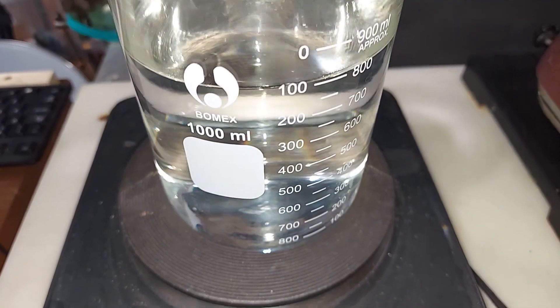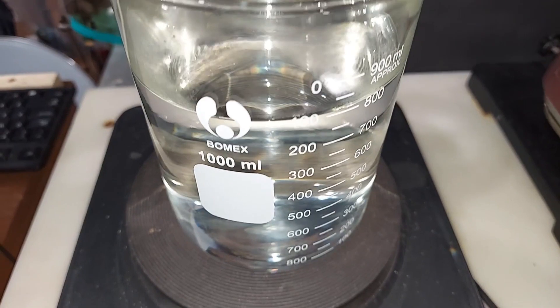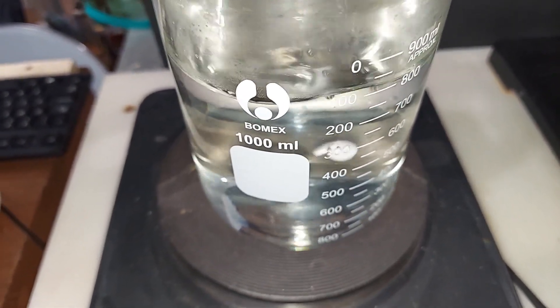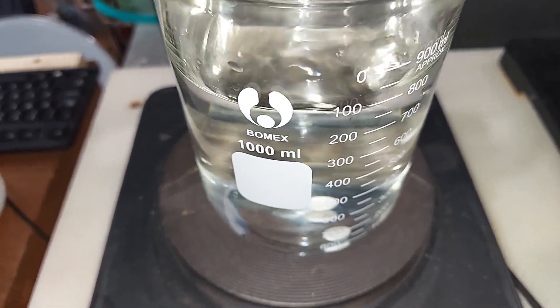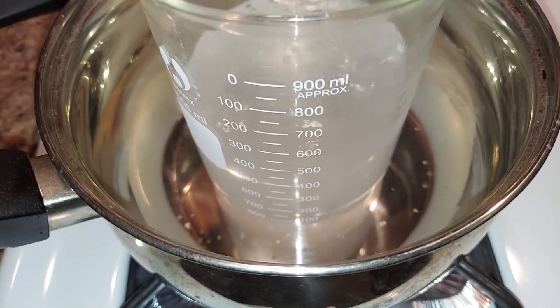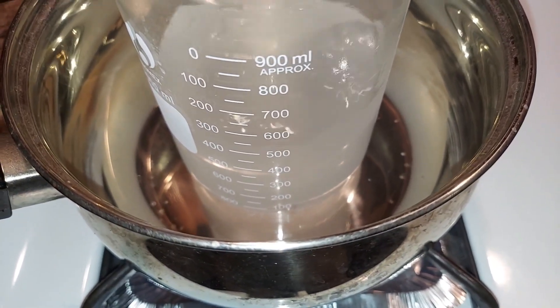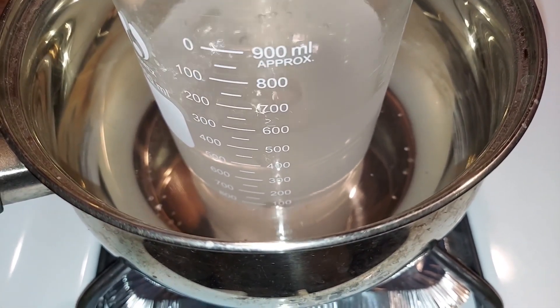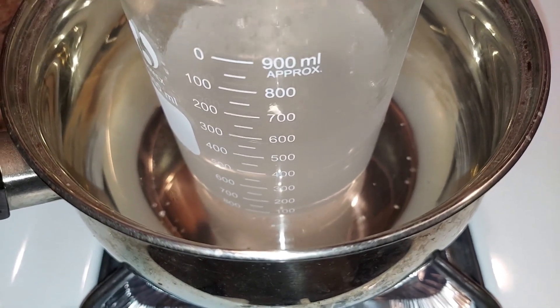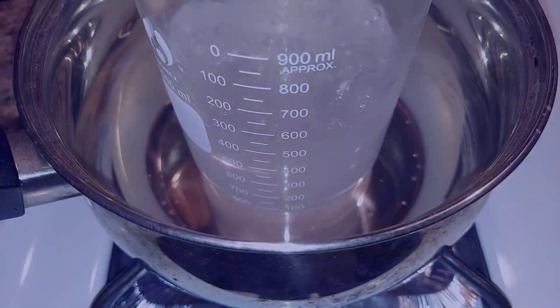Due to the fact that we're using distilled water and the glass has very few imperfections, there are no bubbles, but it is at boiling temperature, so I'm going to start adding aspirin. Once I added the aspirin, I couldn't get this to fully boil in the lab so I brought it home and it's on the stove here boiling away. It should go for about 30 minutes. You really want to boil off all the acetyl portion or you'll end up with some acetic acid in your phenol when you start to distill.